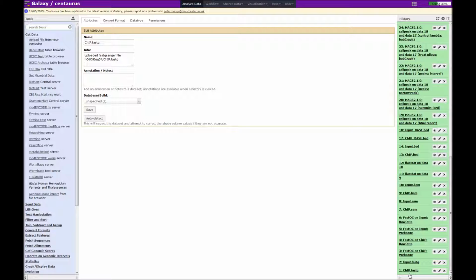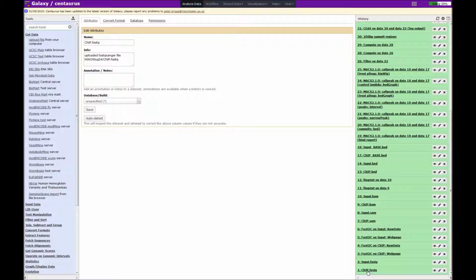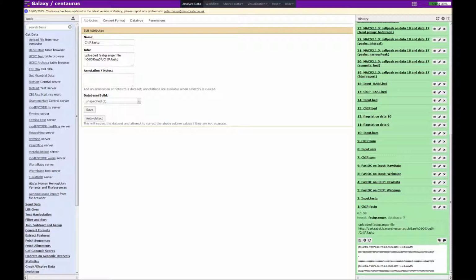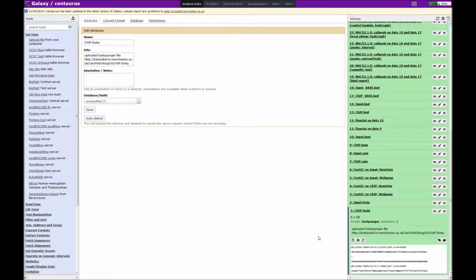So let's just make the history panel a bit wider by dragging this here. And if we want to see what information is contained within the history items, we can just click on its name. Because this is the first one, it doesn't look like anything's happened, but in fact it's appeared just below, so we can just pull this down. And if we click on the eye, we get a view of that file in the middle panel of the Galaxy tool. As you may have noticed, there is also the top few lines of each file in the history item, so you don't have to click on the eye every time you want to see what's in a file.